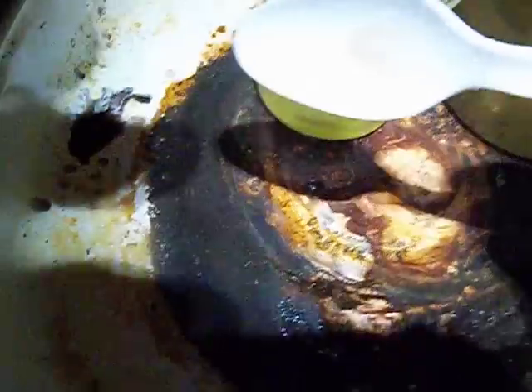I was talking before about the stain left — I don't know if you can see it, but there's a stain in this spoon, and that's the stain you're looking for when you're trying to decide what metal is in the solution. The solution can be any color, but that stain right there is the real test. What's in this little beaker here is really watered down, but if I was going to use it for a standard, I would still have to water it down some more because it's got way too much gold in it to be a standard.